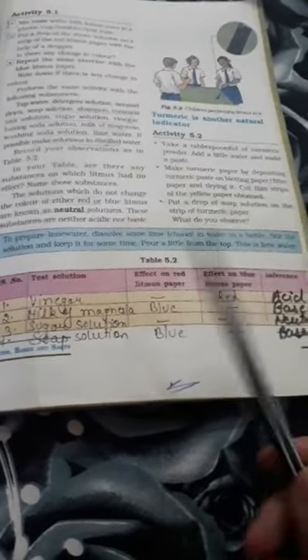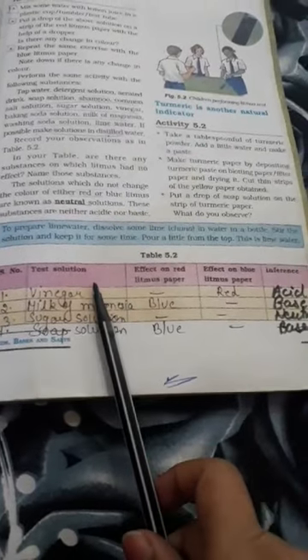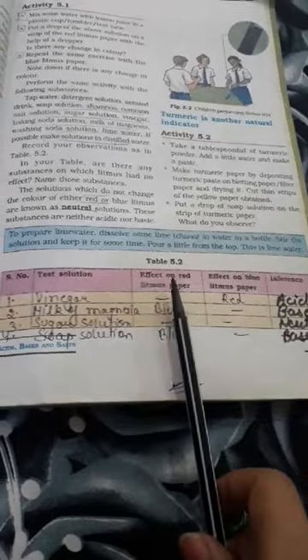Hello everyone, welcome back. In the last session we discussed about natural indicators. To get a better understanding of the working of these indicators, we are given some tables in your NCERT books. We are going to fill those tables today and after that you will be clear with the concept of natural indicators. Table 5.2 is on page number 51. We have to test some solutions with red and blue litmus paper.